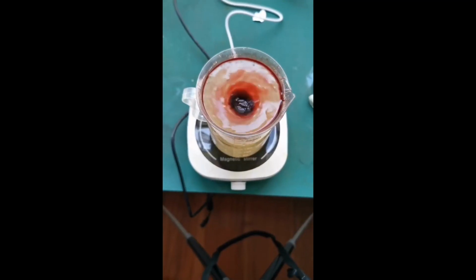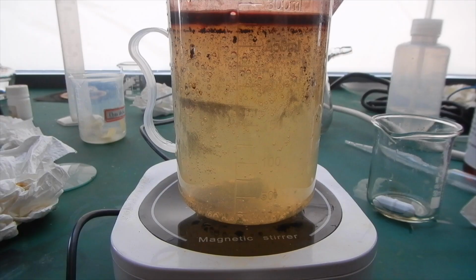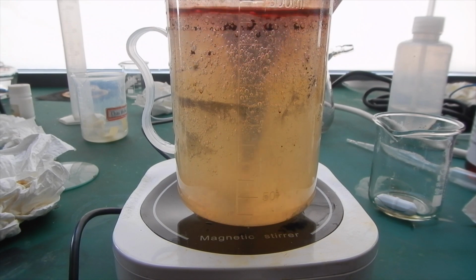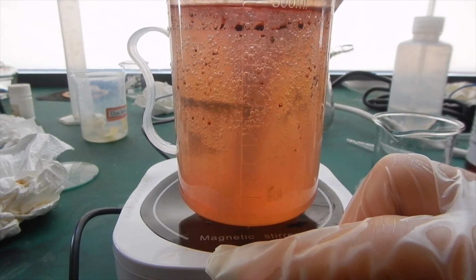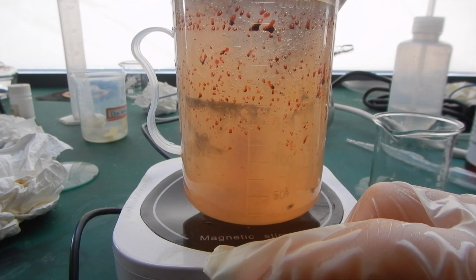The purple-red spiral of iodine slowly fades and disappears in the lower water layer. I then increased the stirring speed, and the spiral was destroyed in the water. The solution turned orange, but only 1 minute later, the color visibly fades. This tells me that most of the iodine left is destroyed by the carbonate.